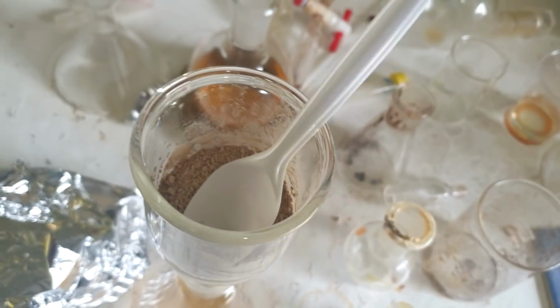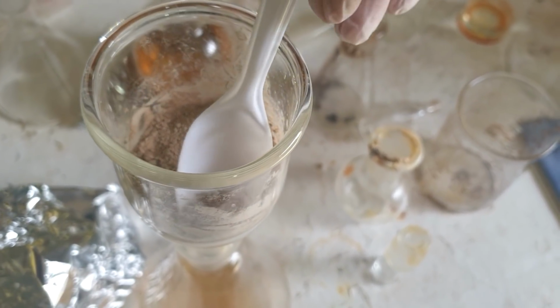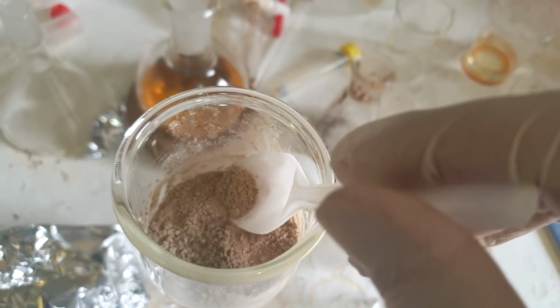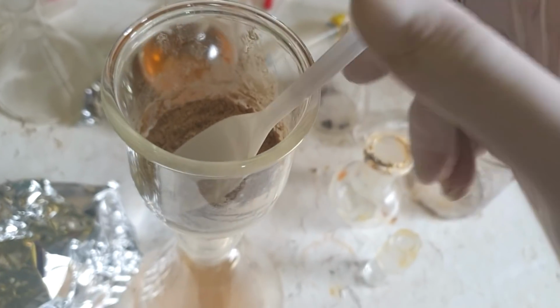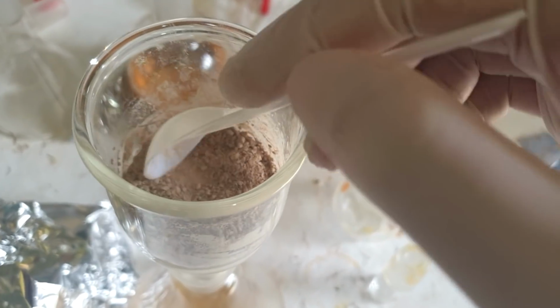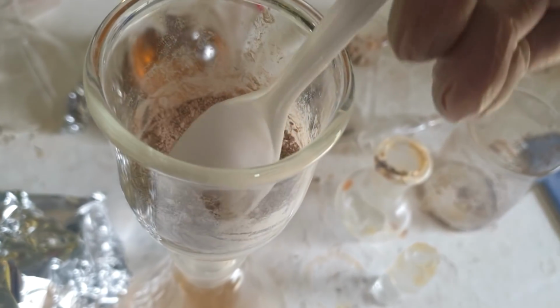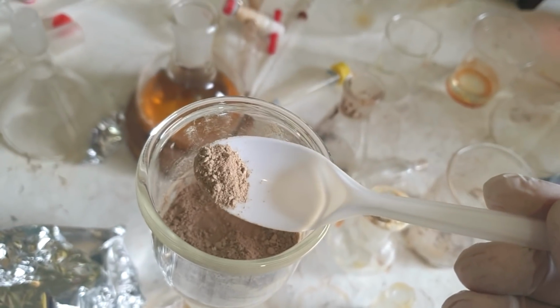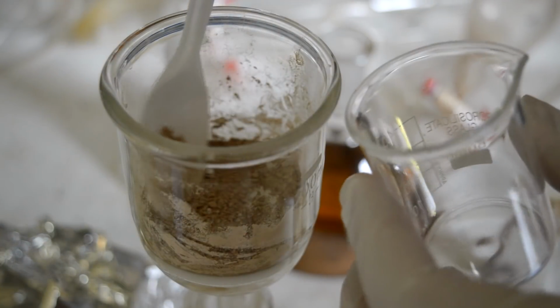That's excellent. What I'm going to do is recrystallize it from some hot ethanol. This has been heating up. I'll just get that back heating again. Make it recrystallize into a bit more of a white color, or something we could call beige potentially, rather than just brown, which this is. I'm not going to pretend and call this beige. If I was publishing a paper, I'd call this off-white. Nah, I'm not that mean. Yes, it's just an off-white product. All right, let's get this recrystallizing.